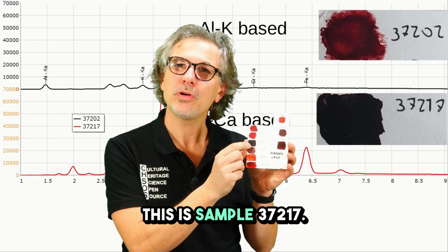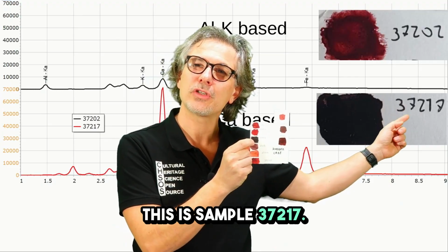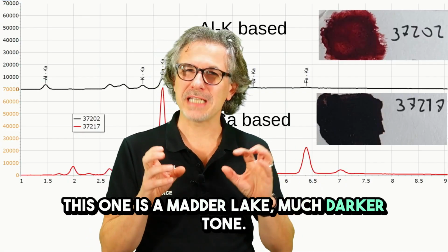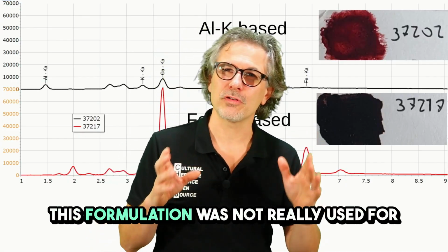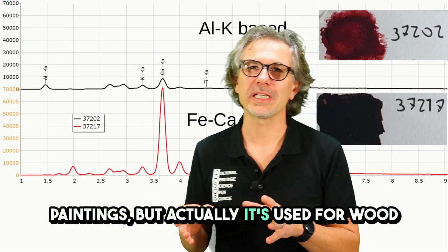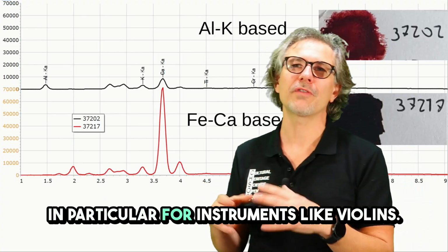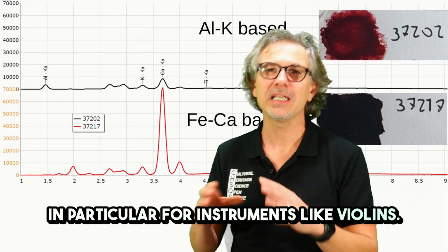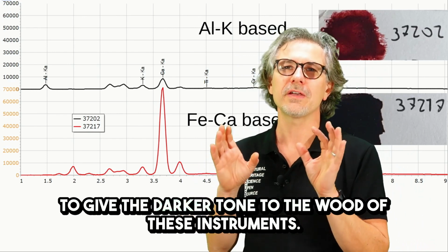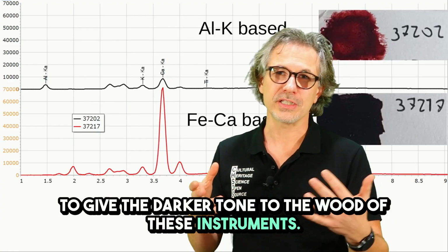This sample, the 37217, is a Madder Lake of a much darker tone. This formulation was not really used for paintings, but actually it's used for wood, in particular for instruments like violin, to give the darker tone to the wood of this instrument.